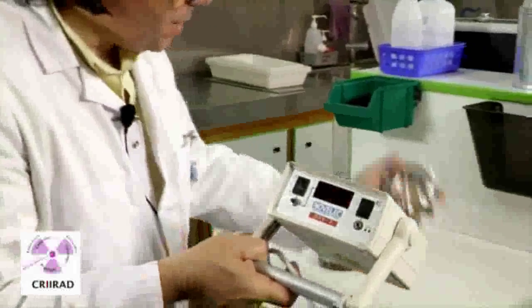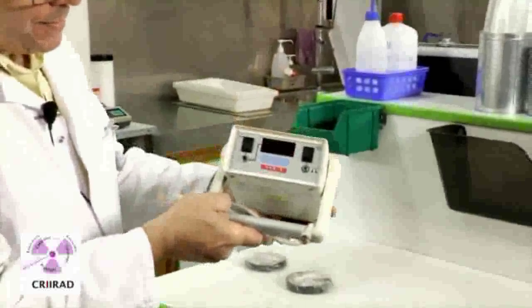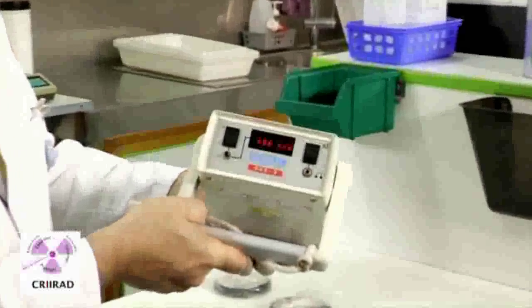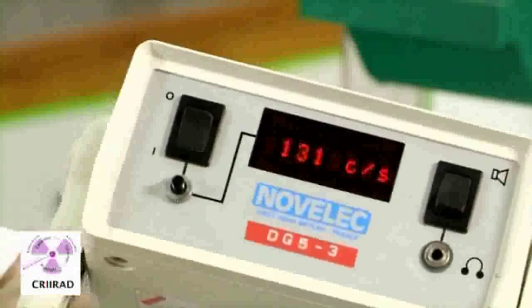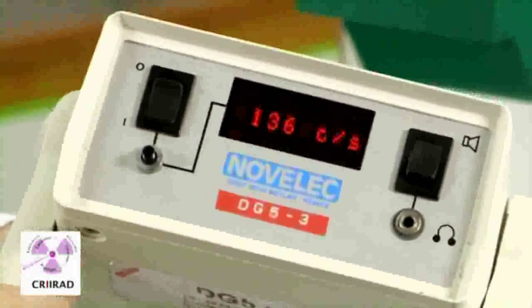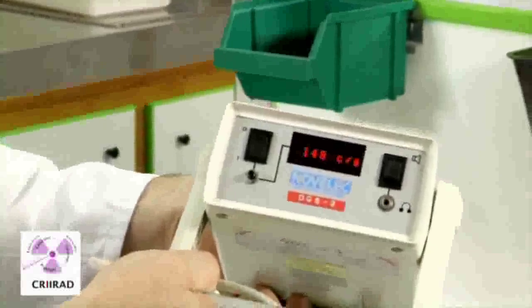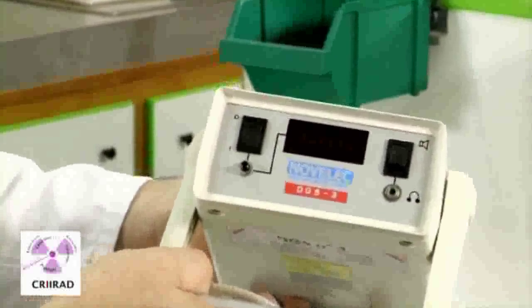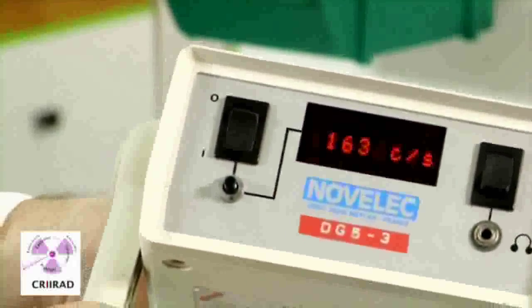In this sample, we have now 2000 Becquerels of cesium altogether and it's more easily detected. The amount of radiation is now about 130 to 140 counts per second. Now, in this sample, we have 3000 Becquerels of cesium-137 and we detect more gamma radiation. We have now about 160 counts per second.